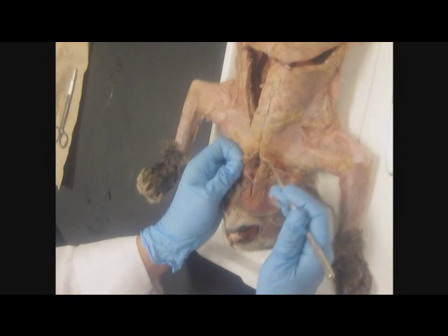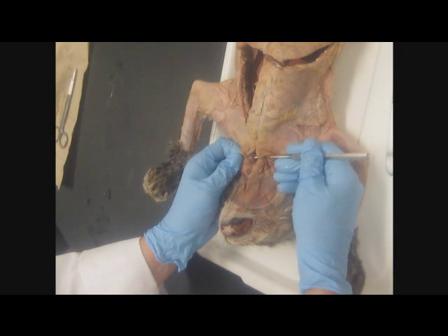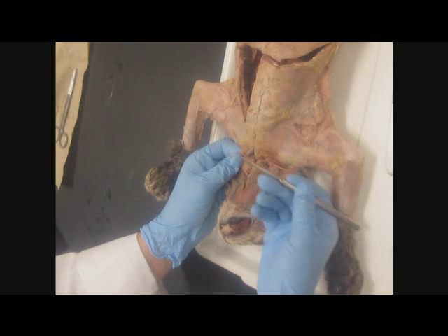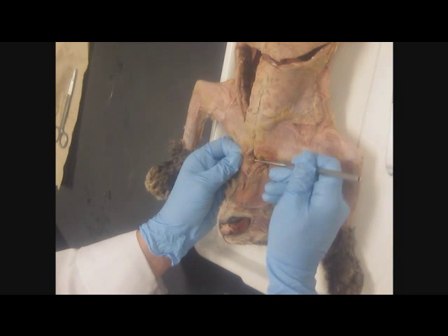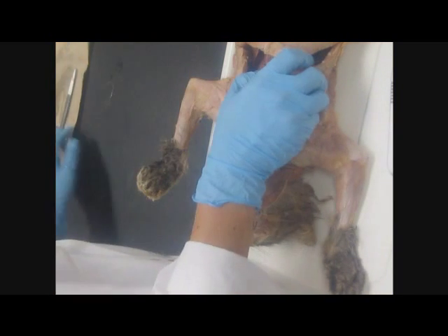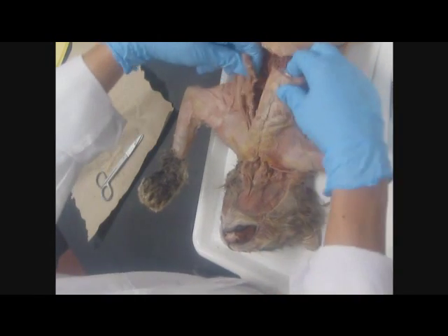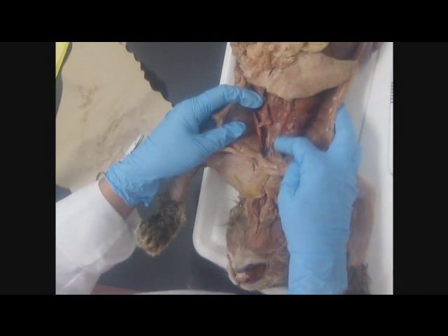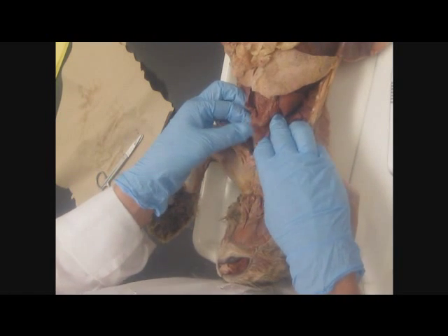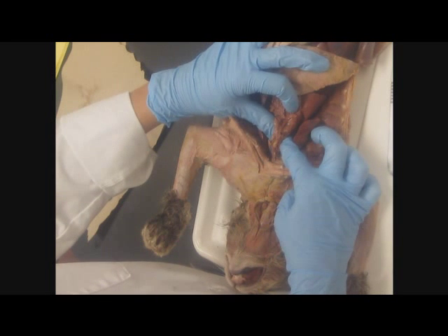Thyroid. Alright, so on the left side, it's going to be right next to the trachea, and it's going to be an elongated brown glandular organ. Right there. Kind of use your probe as a hook. And it's shiny. Now, you can tell. Okay. Thymus. Thymus is going to be right over the heart, under where the sternum was. Thymus. And depending on how old your cat is, you'll have more or less of it. This cat actually has quite a bit. This big glandular blob right here is thymus.